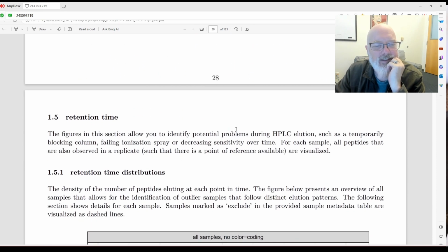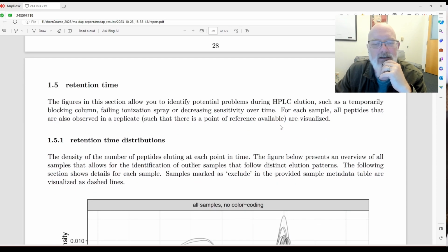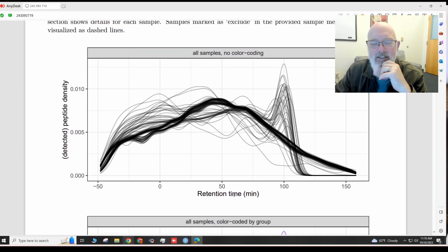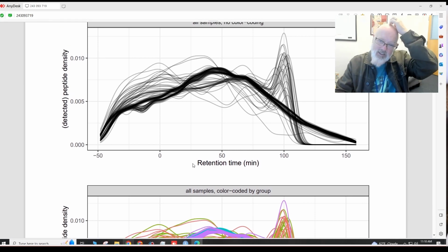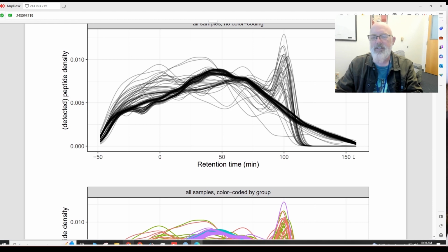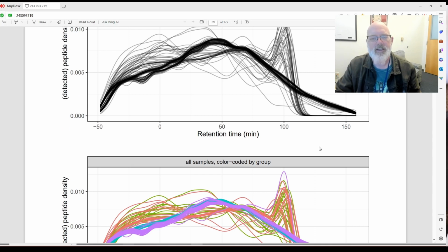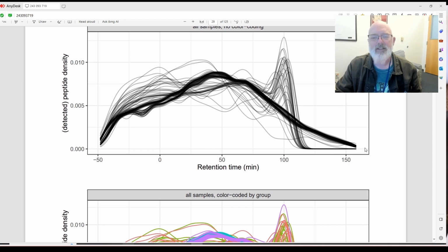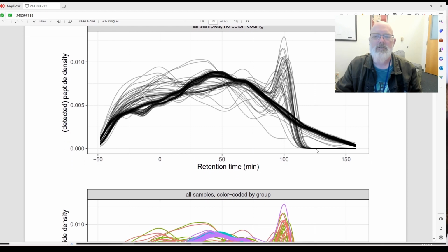Retention time, this figure in this section allows you to identify potential problems with HPLC elution. So let's see what that does. Retention time distributions. So these are the peptides. And you can see this is wrong. So the retention time in minutes is not actually the retention time. It looks like it's an IRT. So IRTs go from minus 50 to 150. And so they're not really retention time in minutes because our run was only 11 minutes long. So this is the IRT, or the relative retention time of the peptides. Okay, so that looks pretty good.